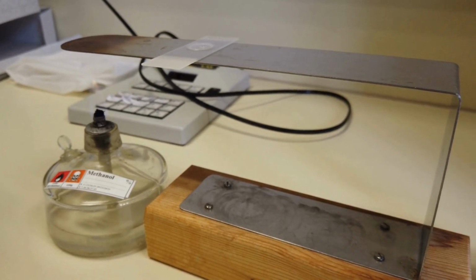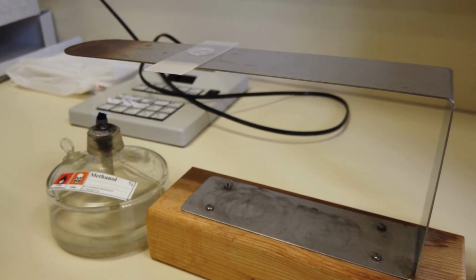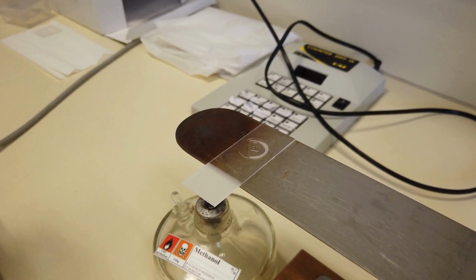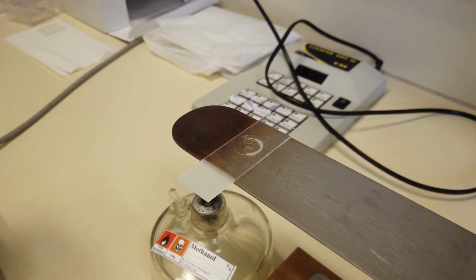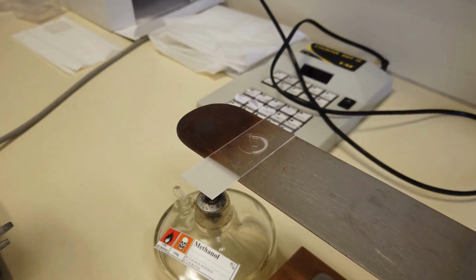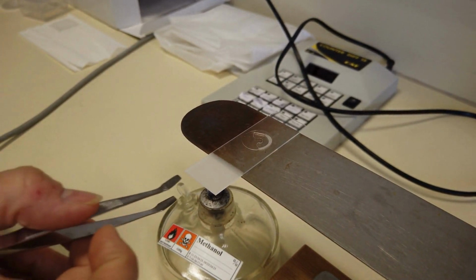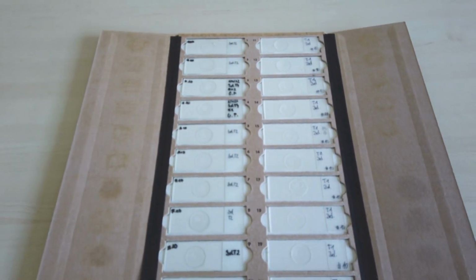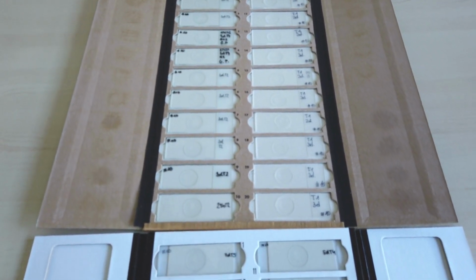The cover glass is placed on one side first and then gently lowered to avoid air bubbles. The next step involves heating a metal bridge with a small burner. The microscope slide is placed on the metal bridge to melt the paraffin. It is important not to place the slide too close to the flame, as this could cause the glycerin to boil and form bubbles, which would complicate morphological identification. Finally, the microscope slide is labeled and stored.